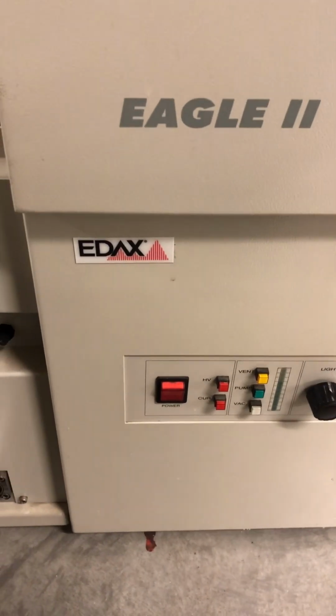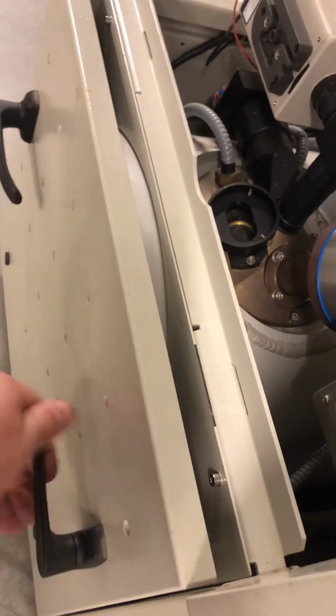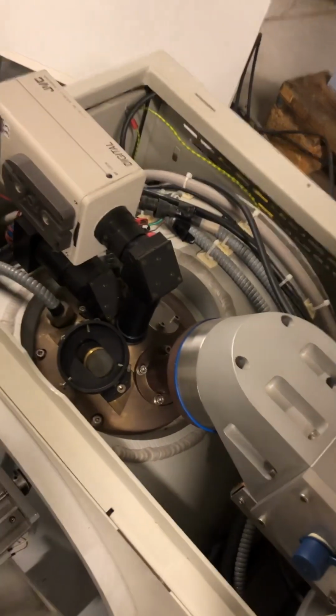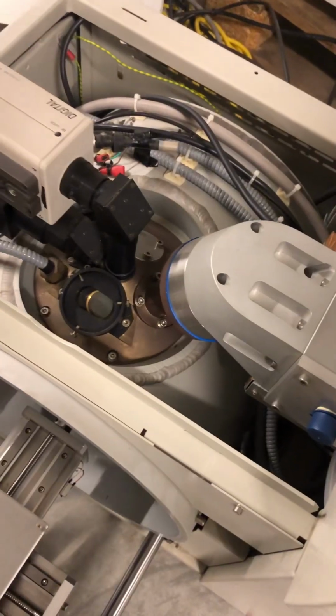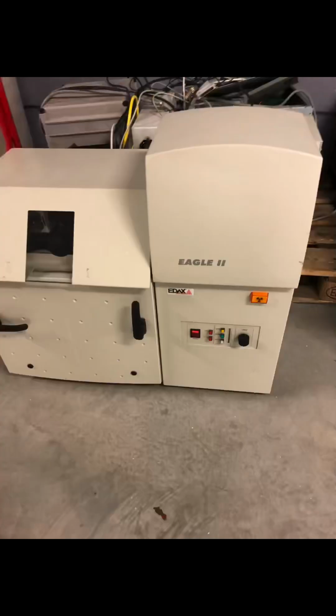Eagle 2 EDAX. It has a scanning table XYZ and the vacuum chamber. On the top is the camera, detector, X-ray lamp is removed, and then we have a cryostat for cooling the detector. On the back side is a pressure manometer, and here are high voltage power supplies.